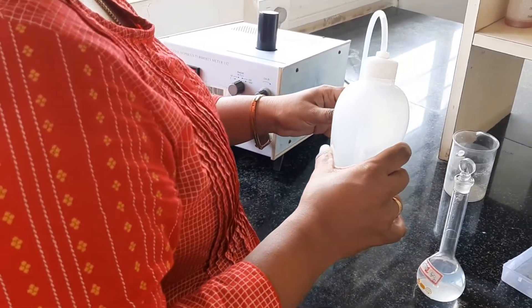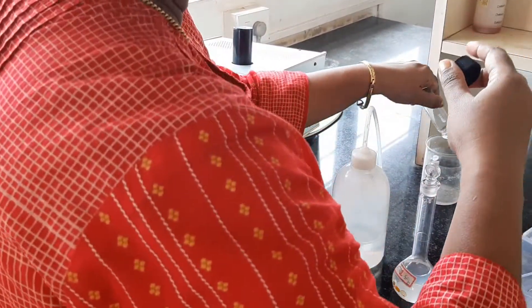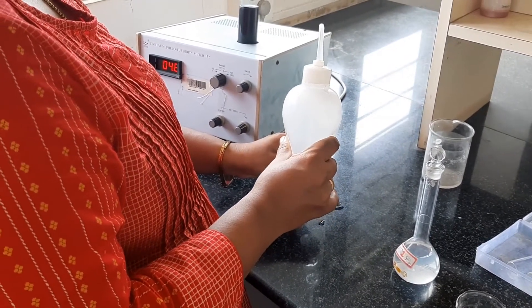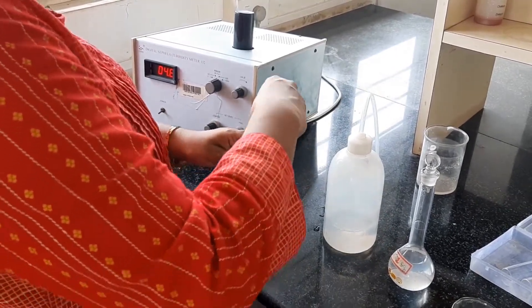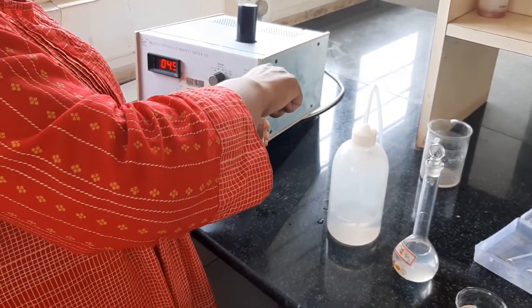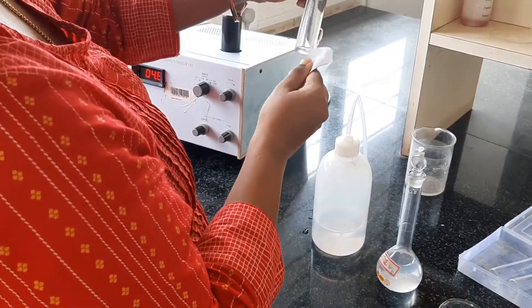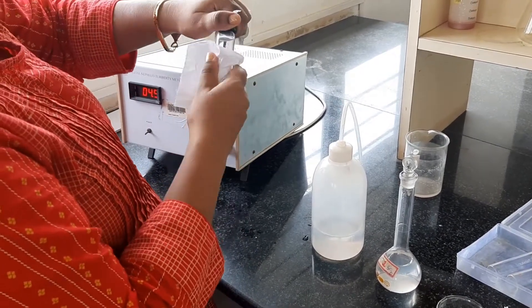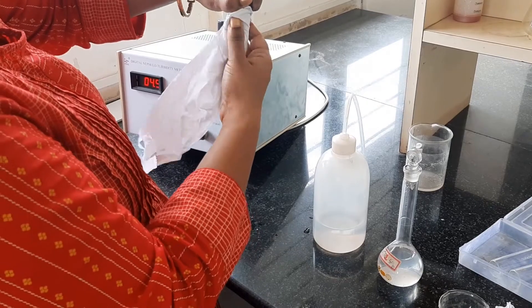So I will just fill this. After filling in, make sure there is no water on the surface, because if you have water it will deflect it and there will be no correct transmission of light — dispersion of light will be affected.